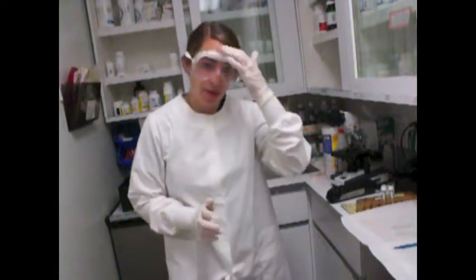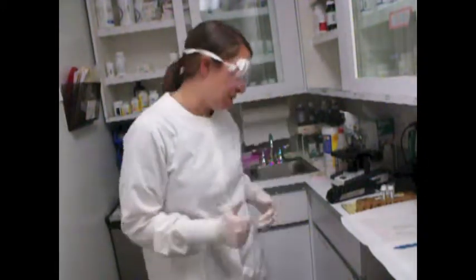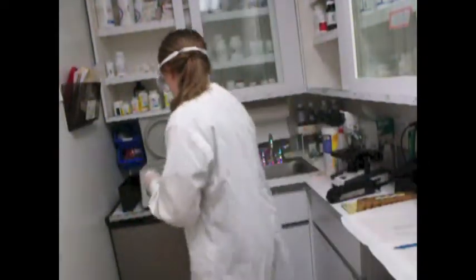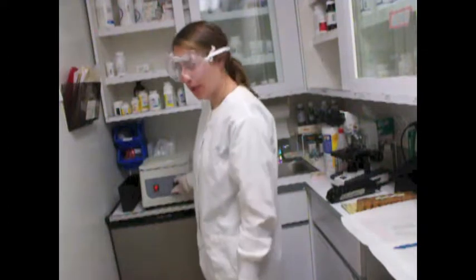So our next step is going to be to centrifuge our urine sample for 10 minutes at about 1500 RPMs. So I have my sample here, and I have my balance tube here. So just going to balance it in my centrifuge. I'm going to close it, and I'm going to set it for 10 minutes, and once it's done, we will decant the supernate, and then we can look at it under a slide.